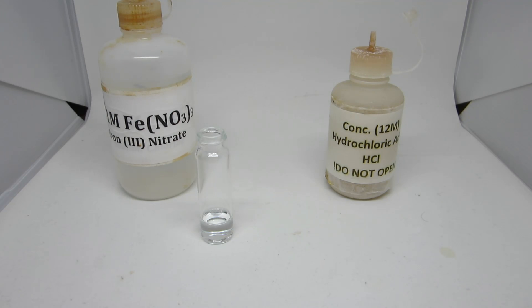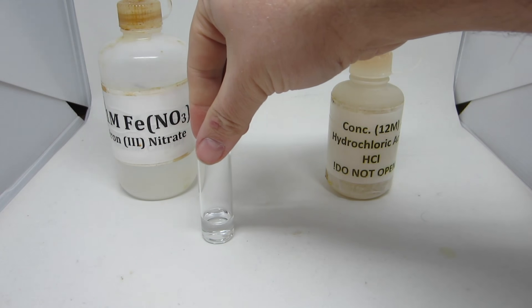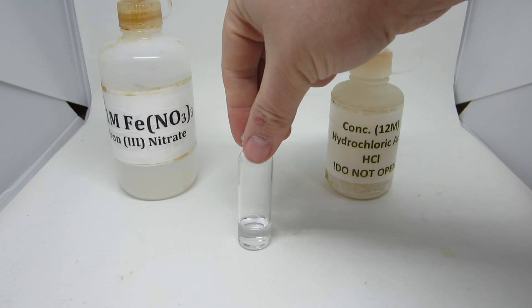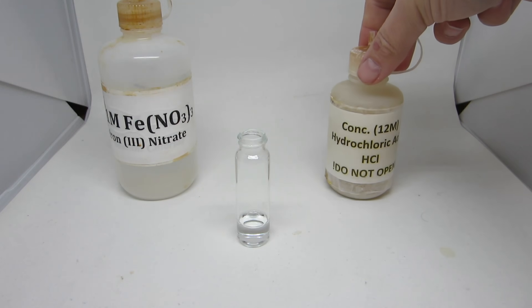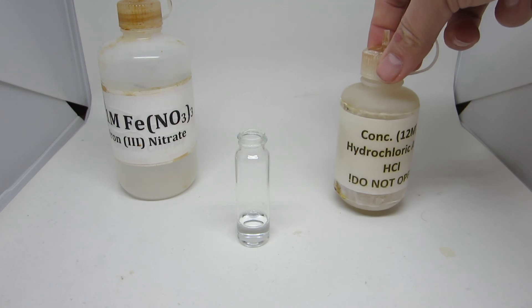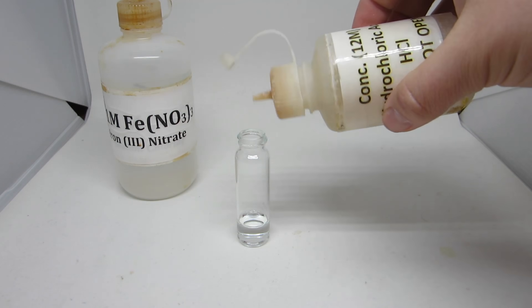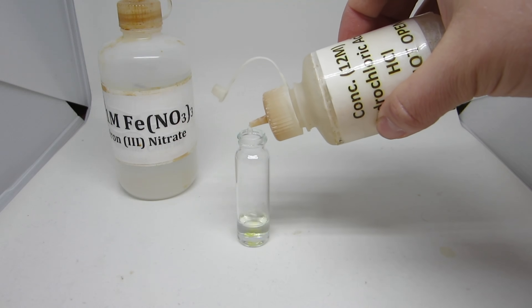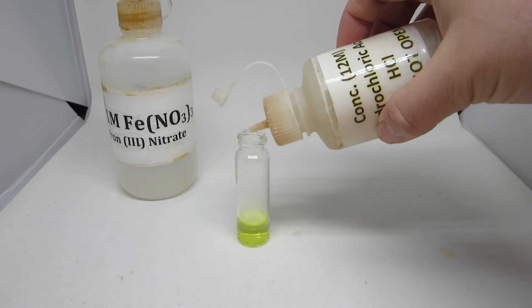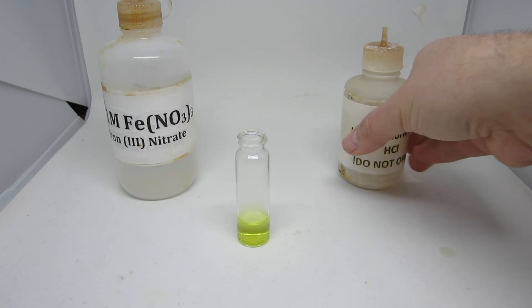In the seventh reaction, we'll be mixing colorless iron(III) nitrate solution with a small amount of concentrated hydrochloric acid. The hydrochloric acid creates an intensely colored yellow solution with the iron nitrate.